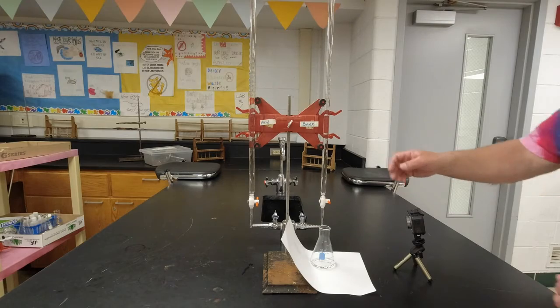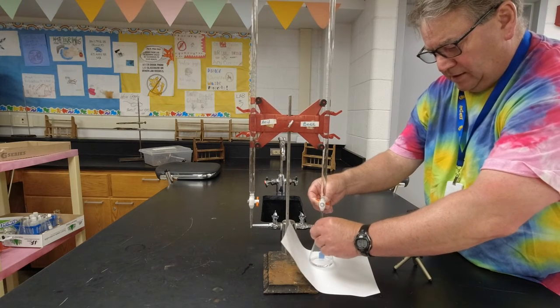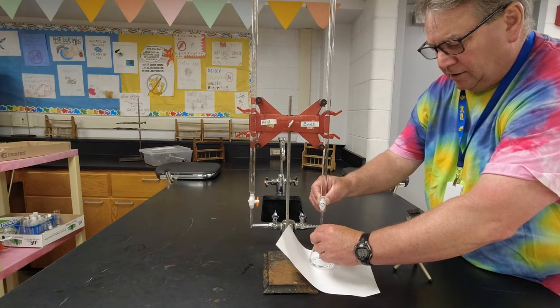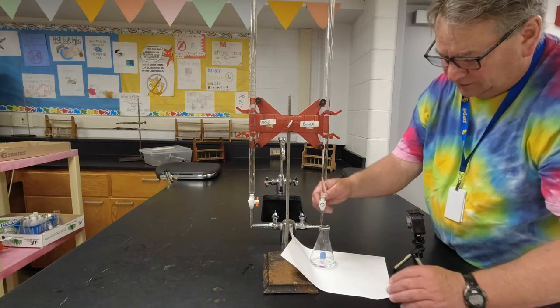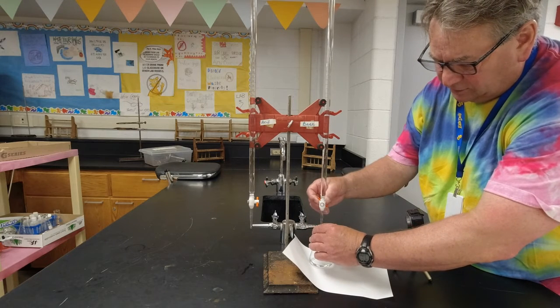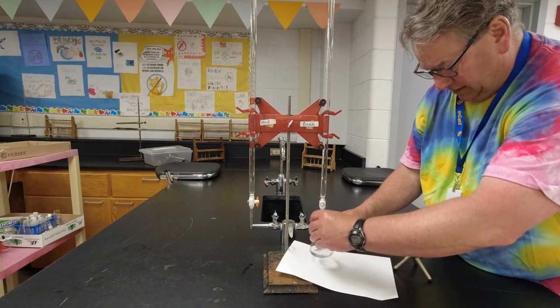All right, so it might be easier for everybody if I do it like this so we can kind of see. You guys can kind of see over there in the front. So when I do this for the first time, I do go really slow, drip by drip by drip. And I don't know if you guys can see that well, but it just turns barely pink every time there's a drop added to it. So a drop hits and you swirl it and it disappears. So we're going to go nice and slow here, drop by drop. So there's a drop every couple seconds here, and I'm going to constantly swirl.